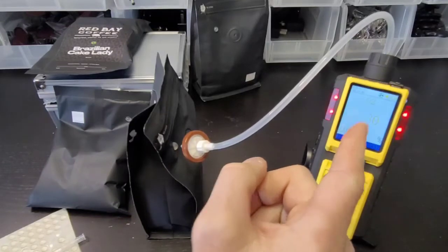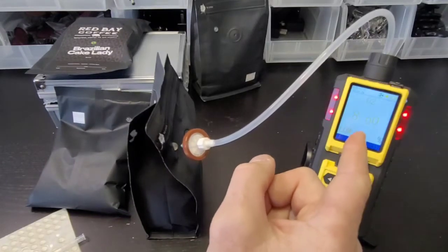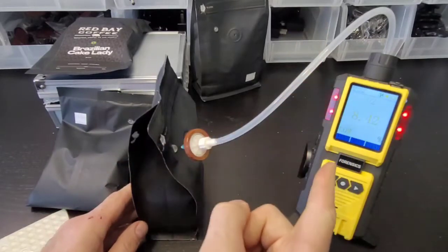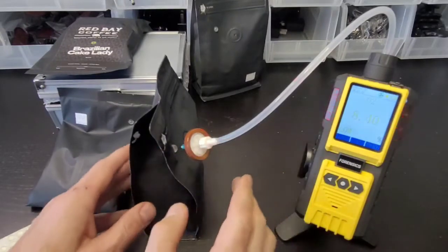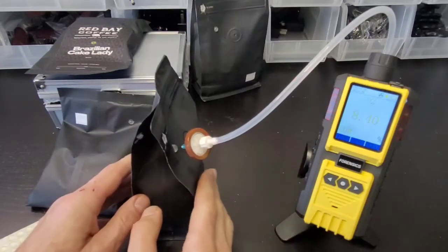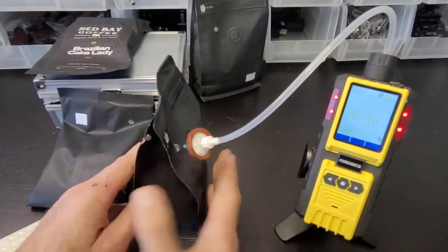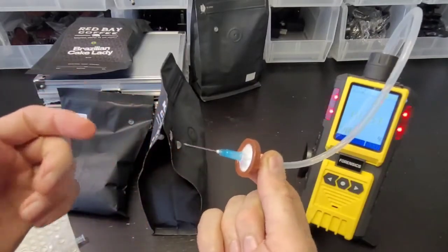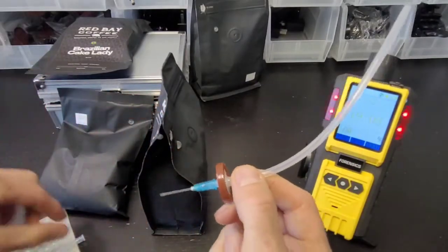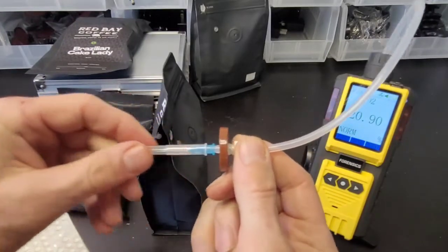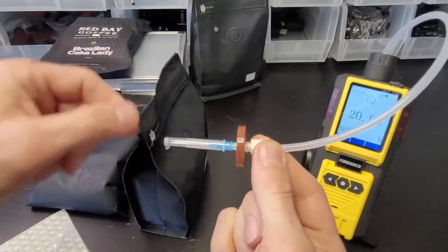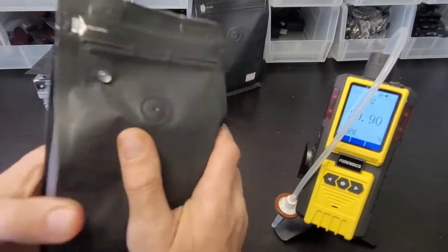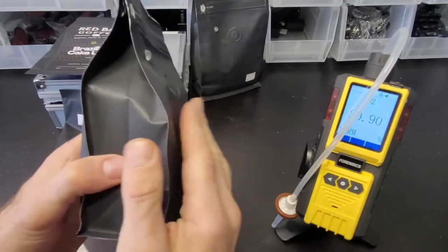It's drawing air, and at the lowest point before it starts rising up, that is your data point - about 8.4%. That's consistent with other coffees we've seen from the customer. Once it stabilizes, you can pop out the needle. Put the cap on to avoid occupational problems or injuries. We know that the packaging or line is actually flushing it with lower oxygen concentration.